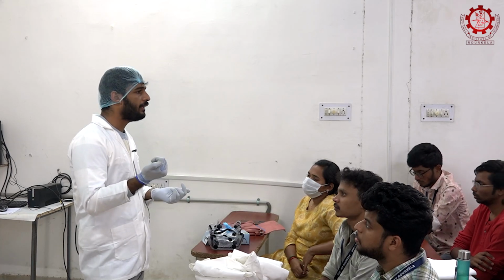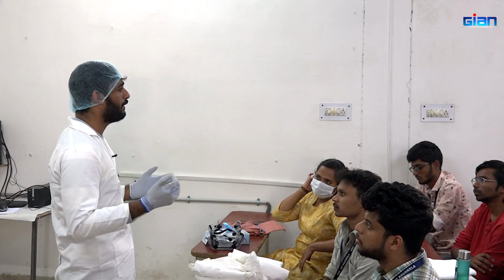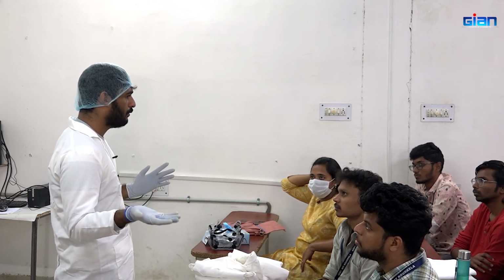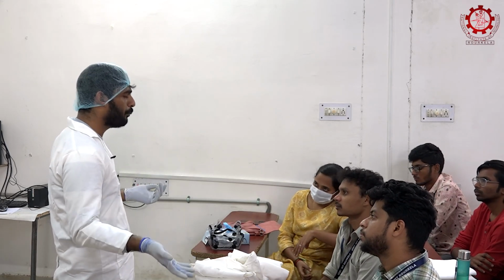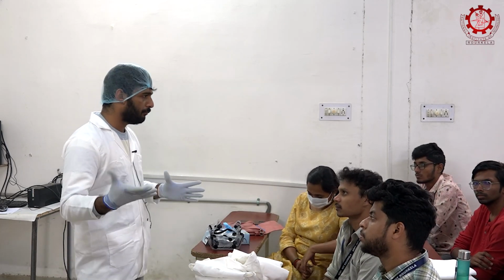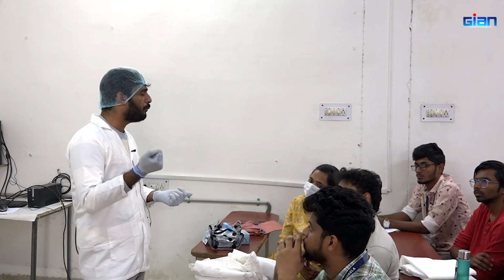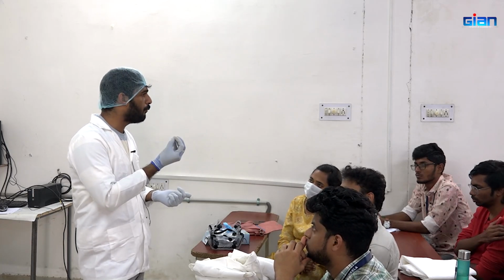We will be slowly adding. Anyway, most of the proteins from plant sources have an isoelectric point which ranges between 3 to 6. So at 6, or at a neutral pH, we will be neutralizing the pH of the particular media. Then we will be slowly adding acid. At a point it will be clumped or coagulated.